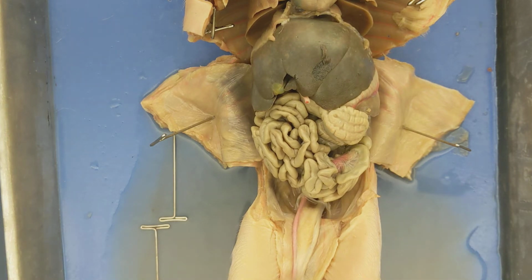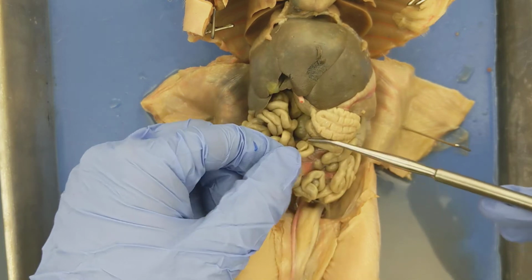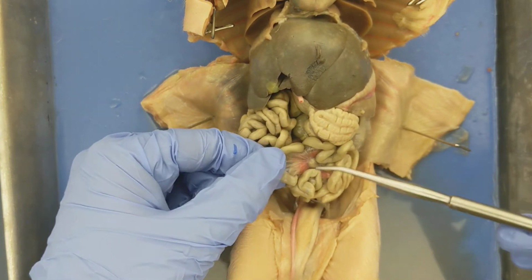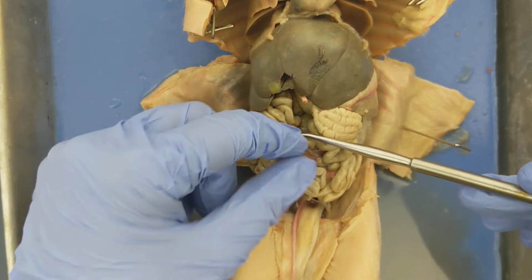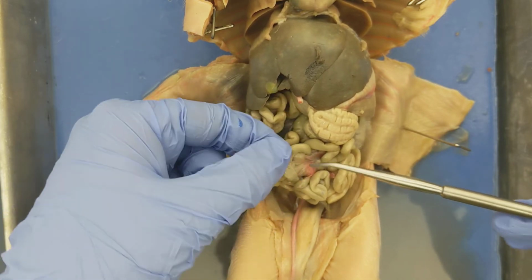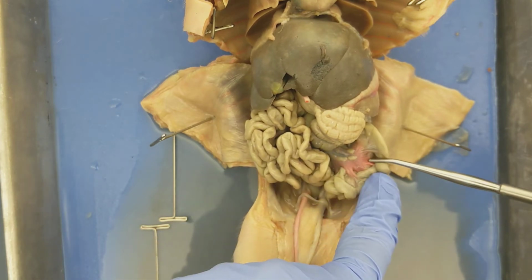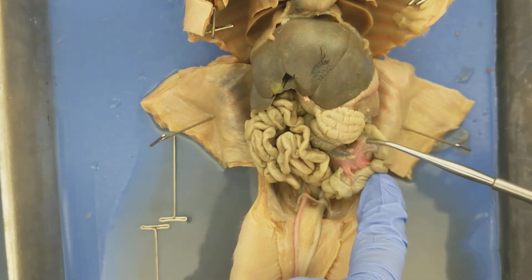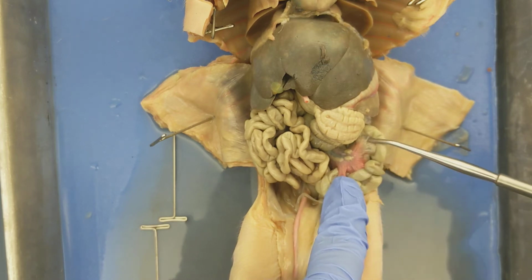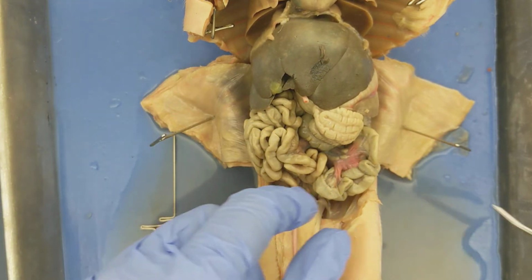Let me put my glove on. I'm going to show you a few more features associated with the intestines once we dig a little deeper. So the intestines are held together by highly vascularized tissue, which you can see here. As I fan the small intestines out, you see these lines in pink. This tissue that bunches the intestines together, there's a really nice view there. This is called the mesentery, all right? And the mesentery exists within the small intestines and the large intestines.